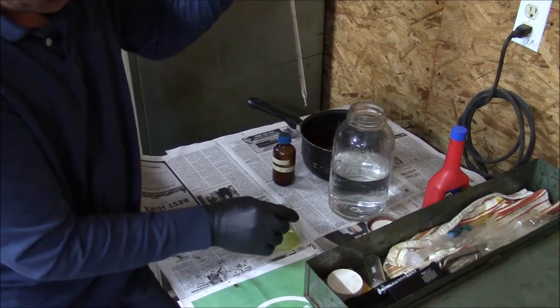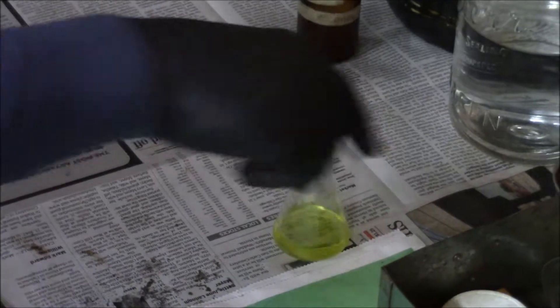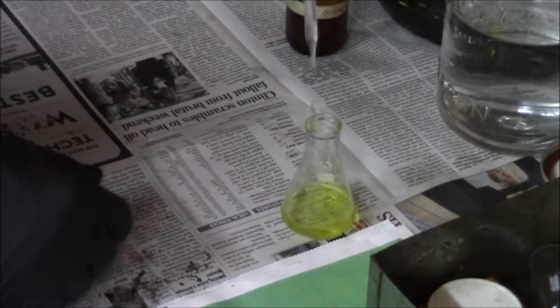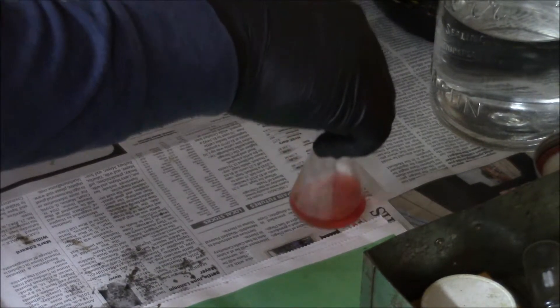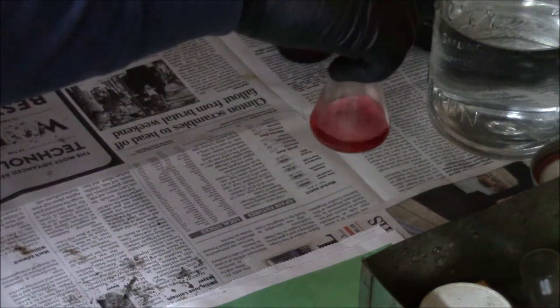The reason I do this — I want to bring this solution to the brink of the color change. So I'm just going to add a drop at a time. As I do this, I'm changing it from acidic to basic. It shouldn't take more than just a couple drops. There it goes. When I change this from the yellow to the pink, I'm just going to make sure that that's a complete change — and that's a nice deep red color of pink.